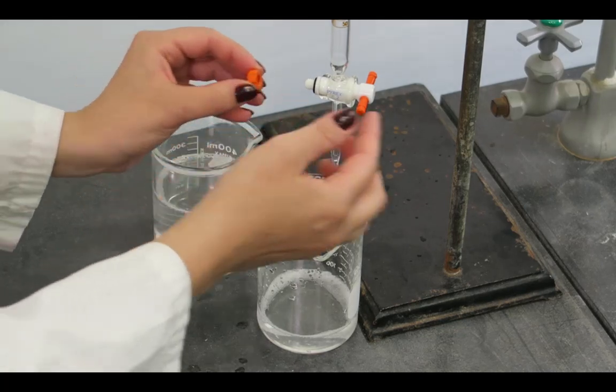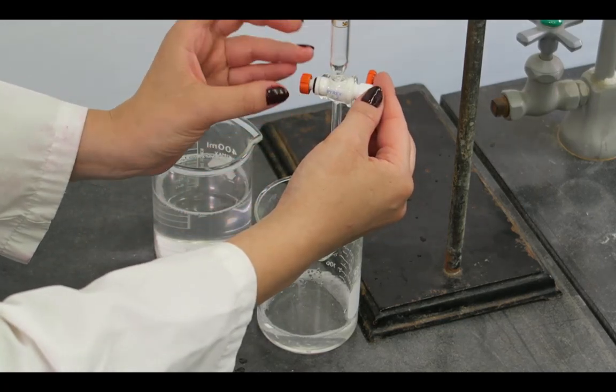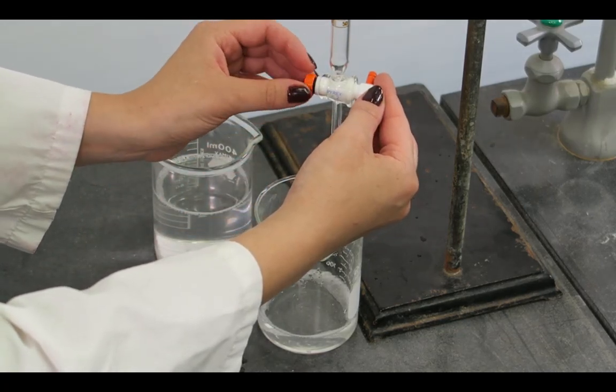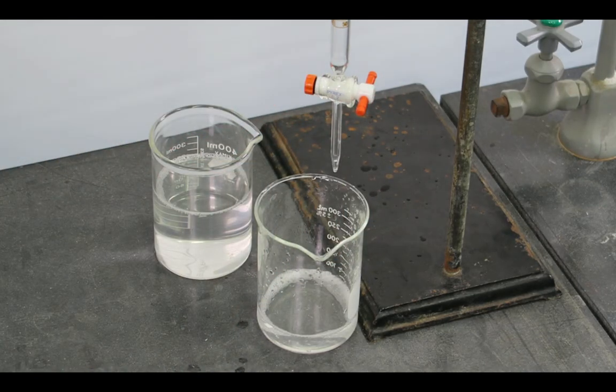Be sure that the correct order is maintained as this is critical for the function of the stopcock. Tighten the teflon nut so that the stopcock can be turned easily but is not too loose.